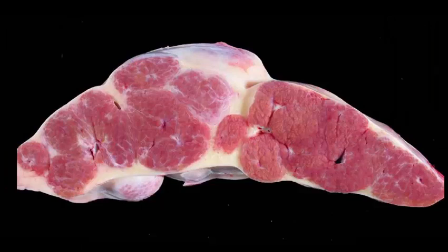Slide number 5. We're moving right along, and this is tissue from an ox. I'd like a morphologic diagnosis and 3 possible causes. Okay. Morphologic diagnosis. This one's a little tricky, because we have very pink tissue, somewhat nodular, with a lot of fibrous connective tissue surrounding it. And a lot of people have trouble identifying this as liver.